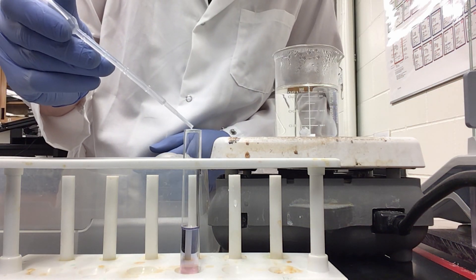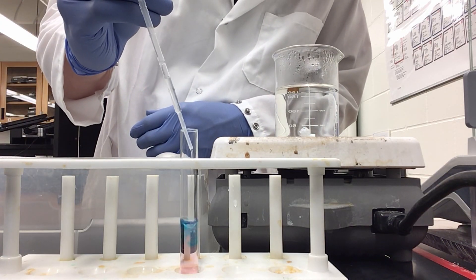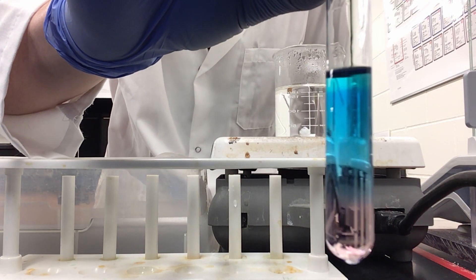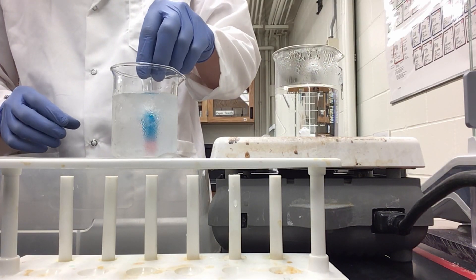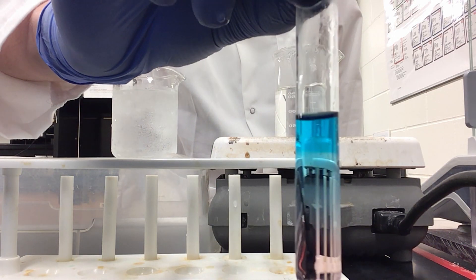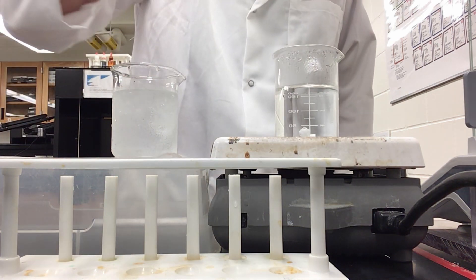I will add just a little bit more water to make sure it is entirely pink. Now I am adding one and a half milliliters of calcium chloride back into solution. The solution is now mostly blue. I am going to take this and add it to my ice bath. This is our solution after the ice bath — you can see there is somewhat more pink in the solution, but we still have some blue up top.